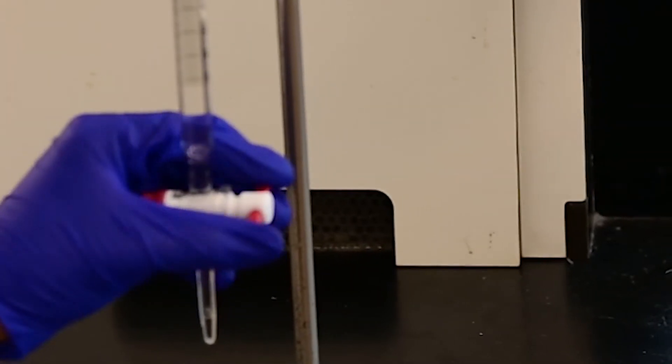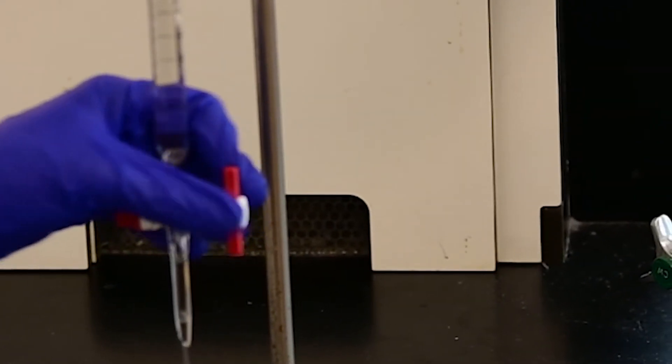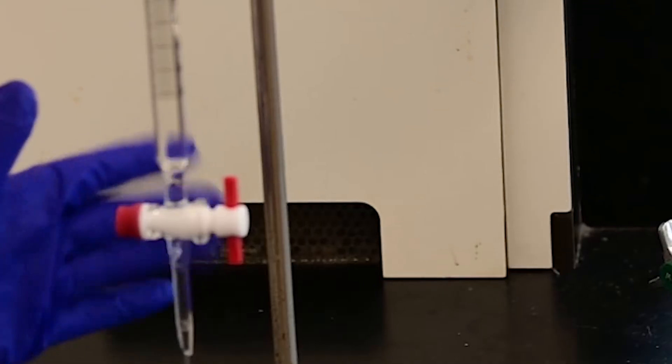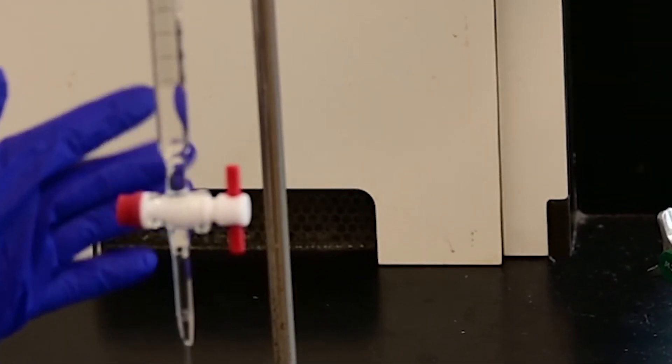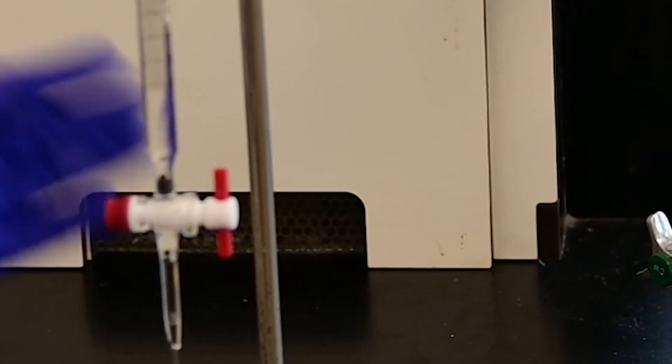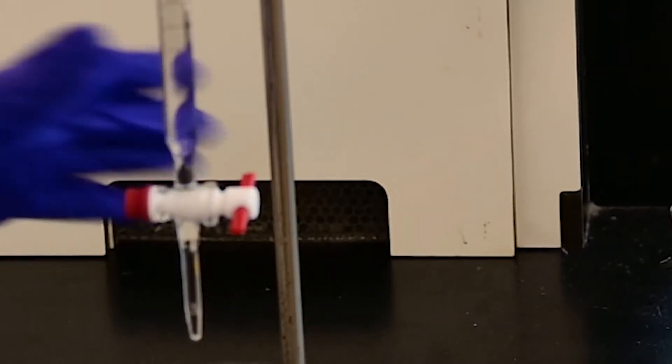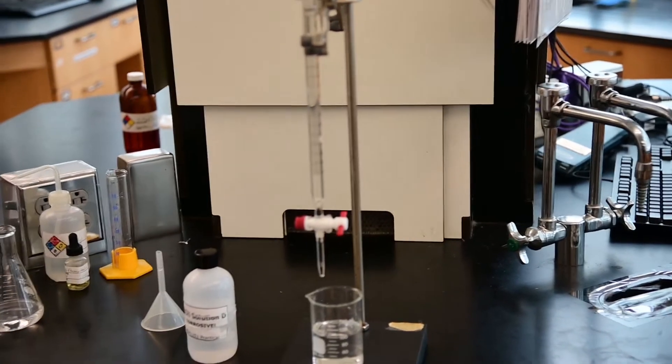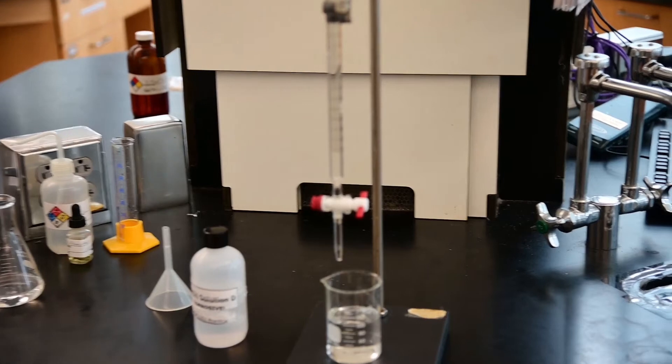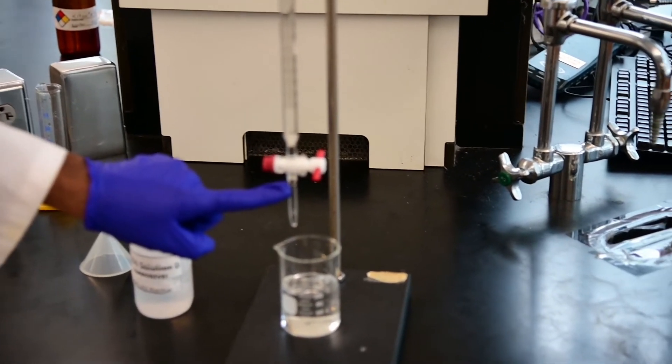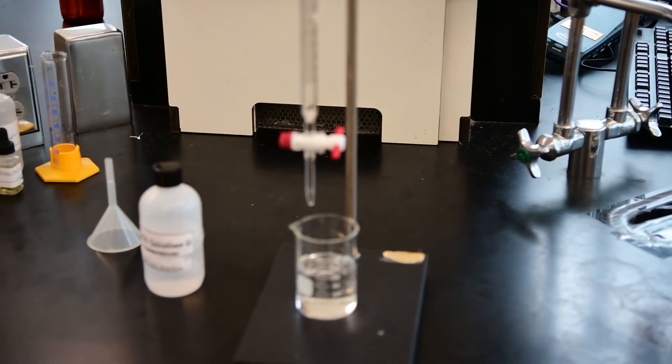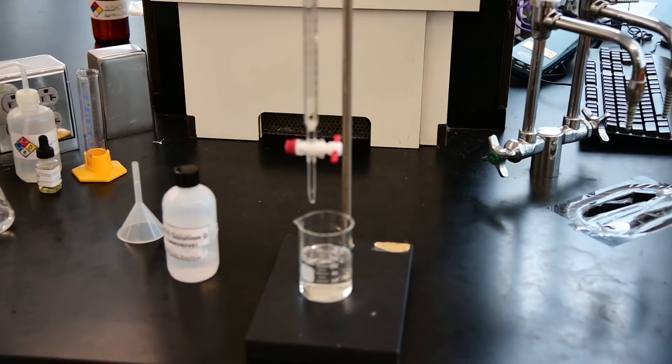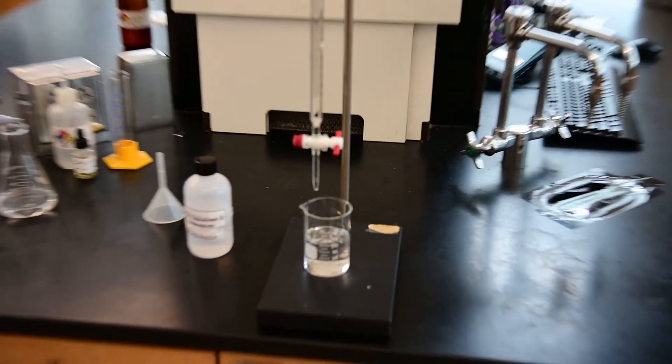You might have to close and open a couple of times. This is tricky. This takes some time. Sometimes you have to refill the burette completely to be able to get rid of the air bubble. But right now, I can see if you zoom in, there is no air bubble left where it was. So we could get rid of the air bubble, but we have also lost considerable amount of sodium hydroxide.